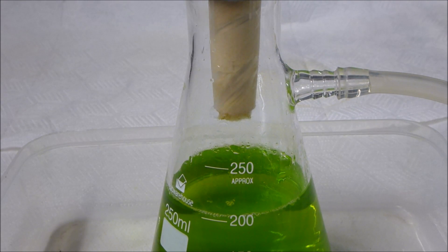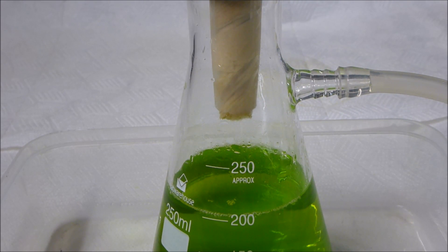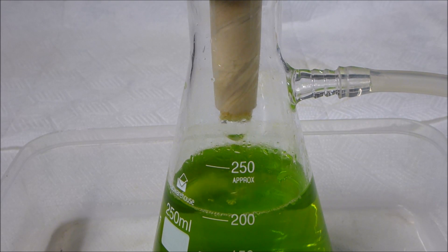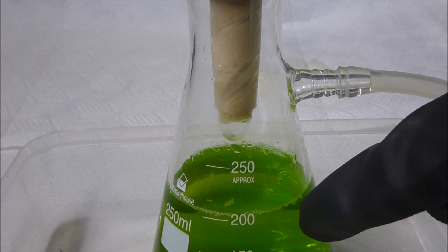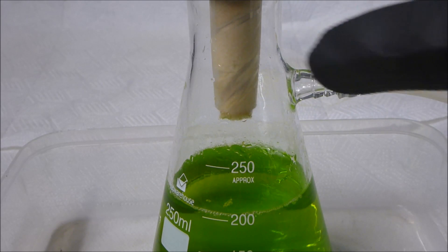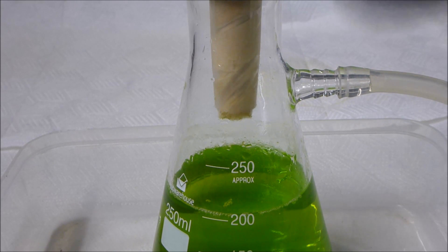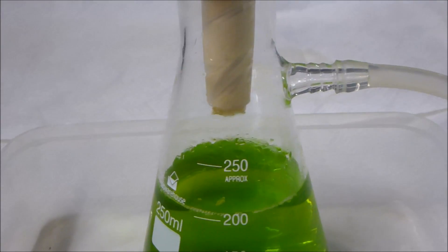So it's about 10 o'clock now, so a couple of hours have gone past. I probably pop by once every 40 minutes or so to give the vacuum pump a few squeezes. We're at about 200 milliliters of solution now. I have diluted this substantially to wash any excess solution out of the paper and the remaining junk up above.